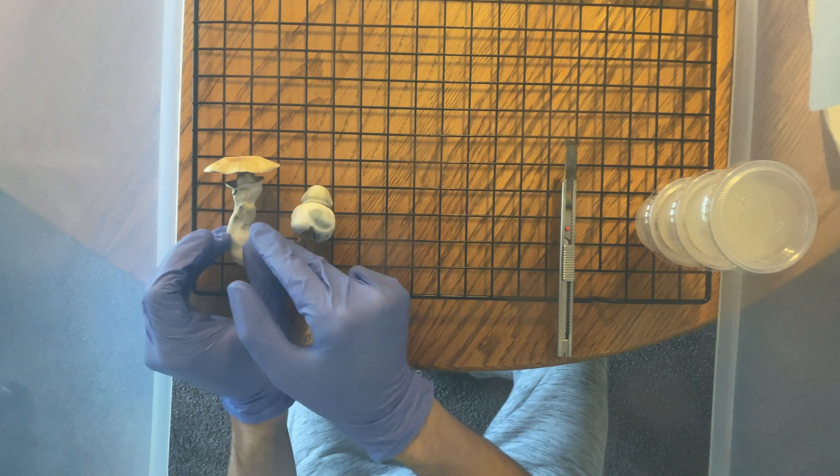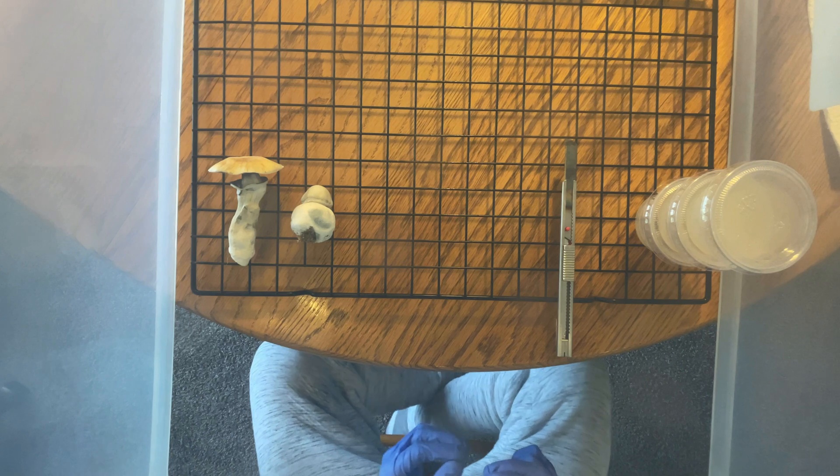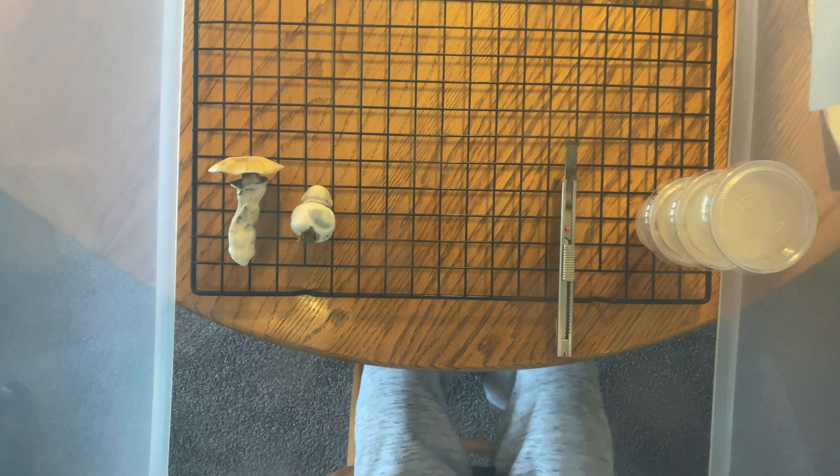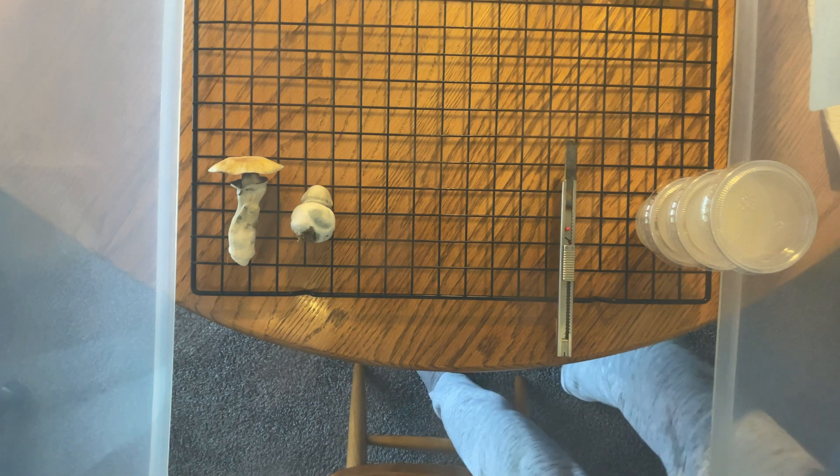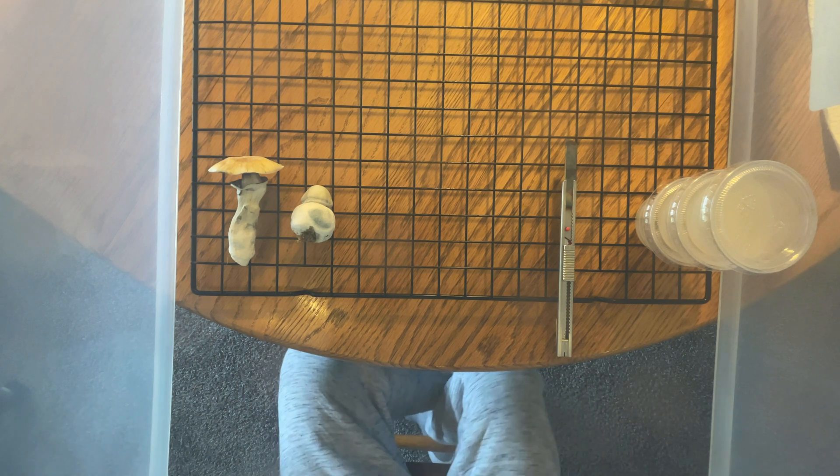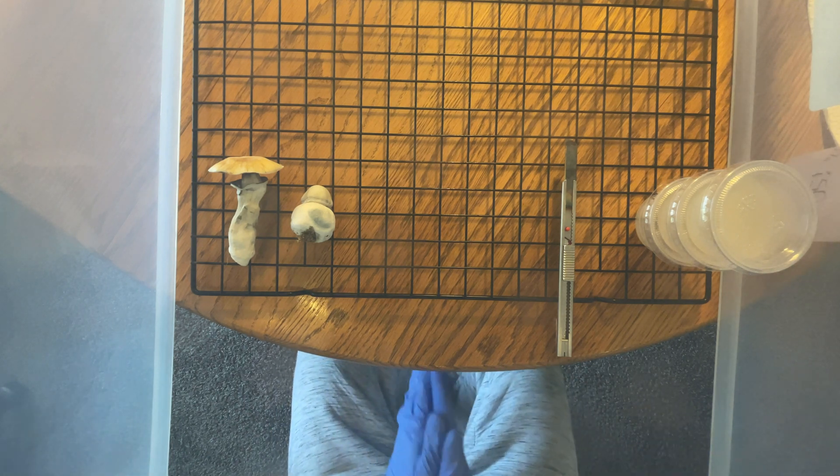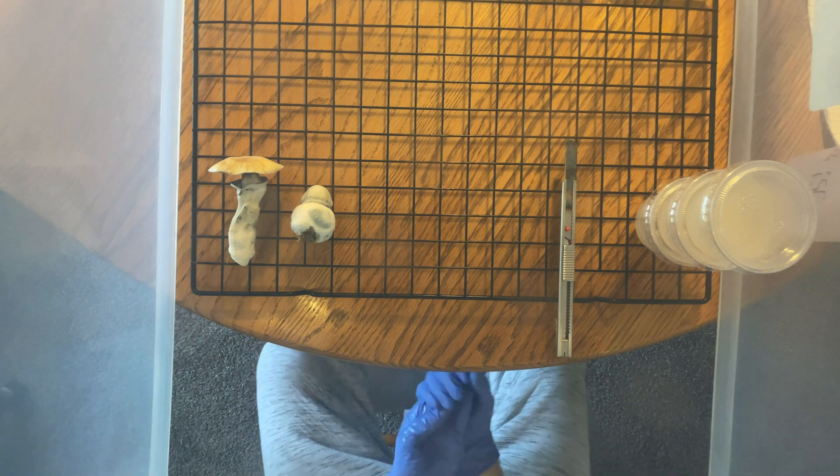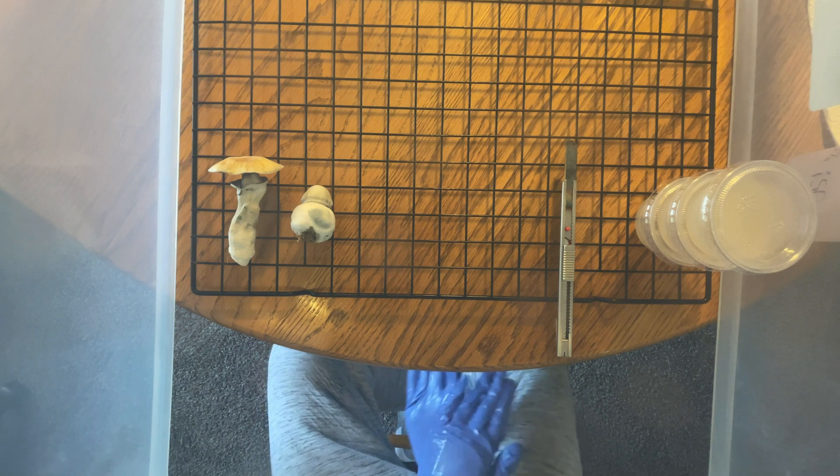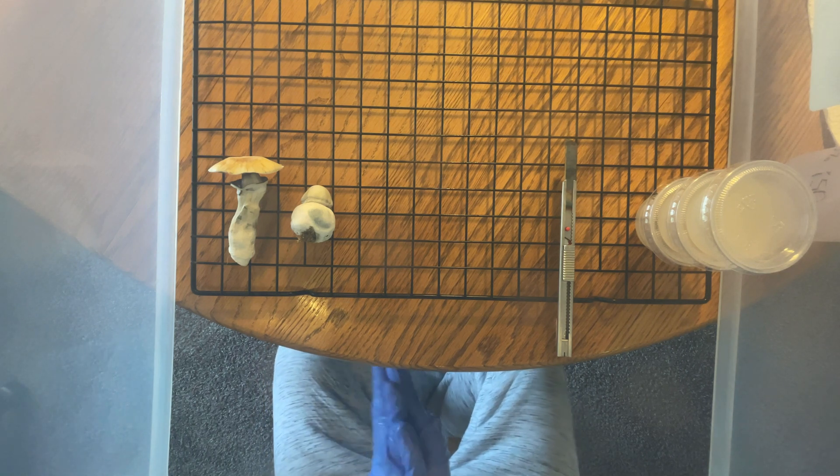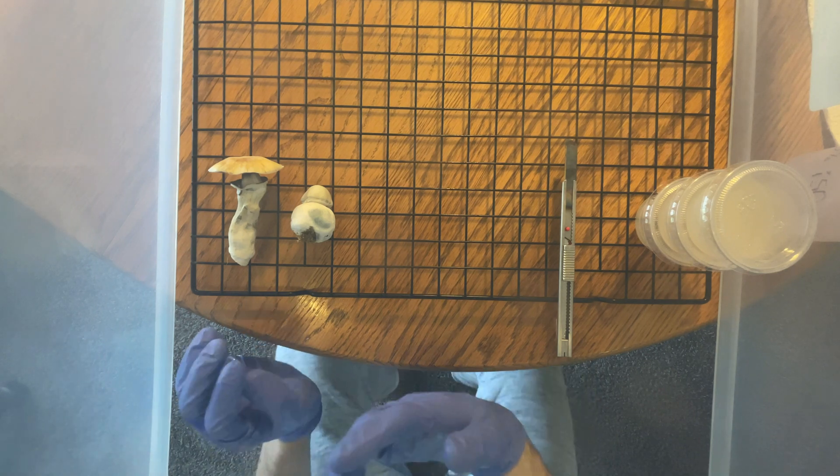To start, make sure to iso your hands and make sure they're clean. I also like to stage my agar plates at this time, as it makes everything much easier. So just popping the lid off on these, or when I'm using plates, will grab the plate and put it down and wait until I'm ready for my transfer.